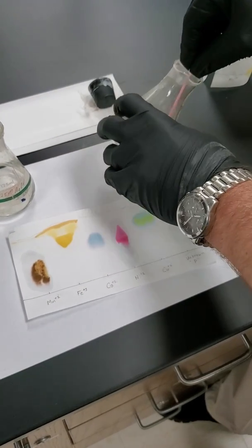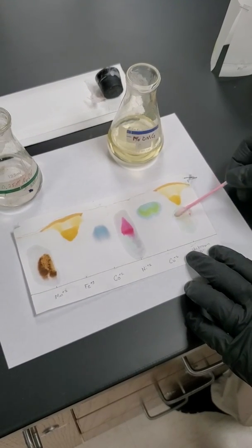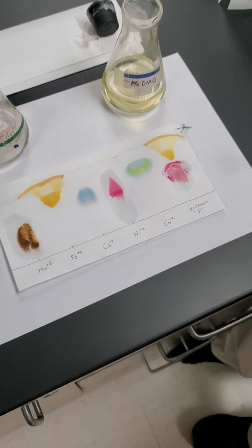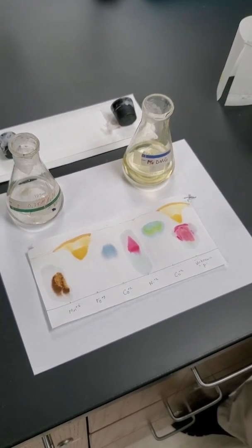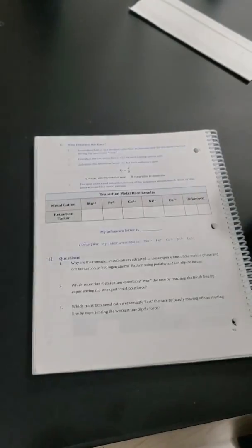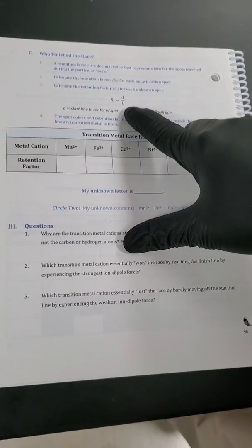As we go over to our unknown to see if, again, we have one hiding, and sure enough, our pink color is starting to appear. So now we have our second identity to our unknown. So at this point, the lab should be completed on this page. Again, unknown P is going to have 2 answers in it now that we've matched up. Very similar, we're going to calculate how they finish the race.